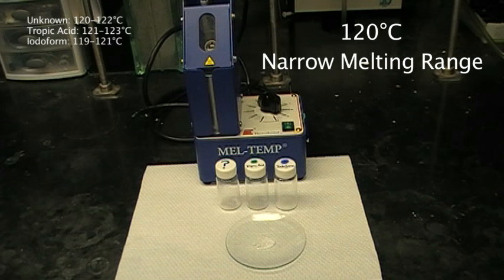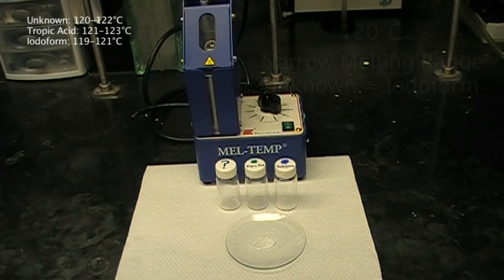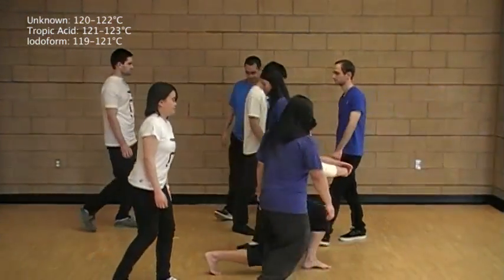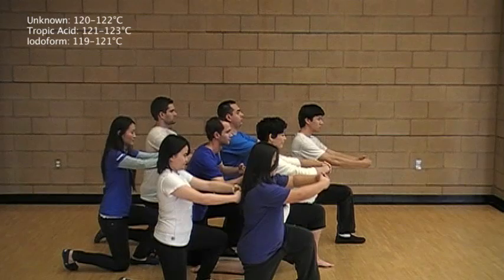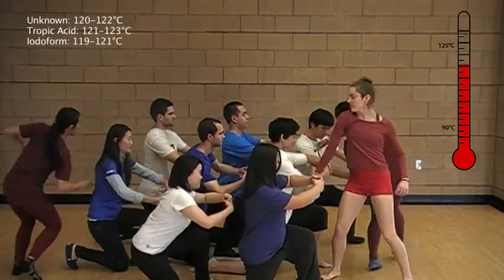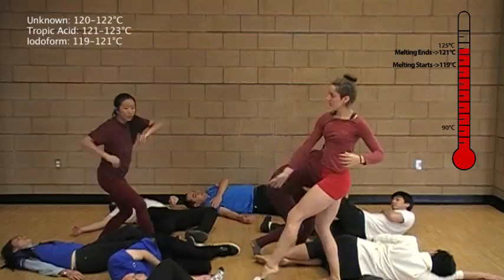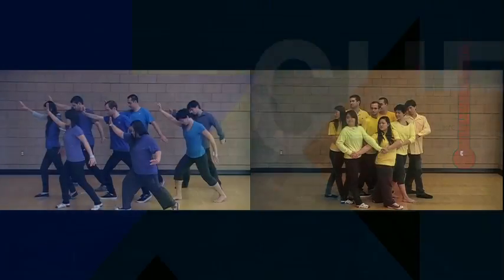This tells us that the identity of the unknown is iodoform. The identity of the unknown compound is actually iodoform. Therefore, when we mix together the two compounds, we aren't introducing any impurities or other new compounds. The molecules are able to stack together nicely because they are one and the same, and this is why the melting range is exactly the same as before we mixed the two solids together. This is how mixed melting point can be used to figure out the identity of an unknown solid.